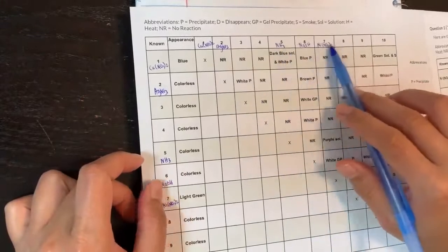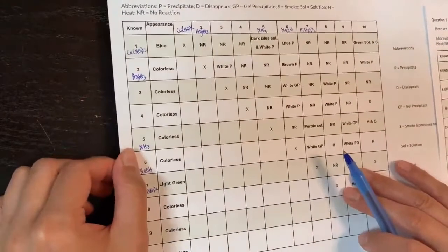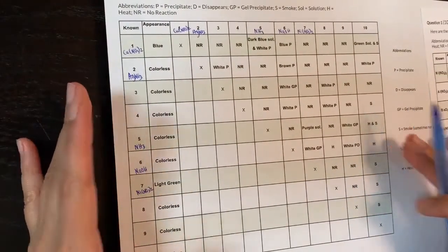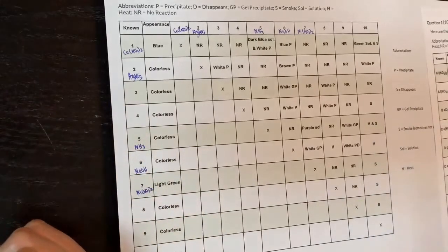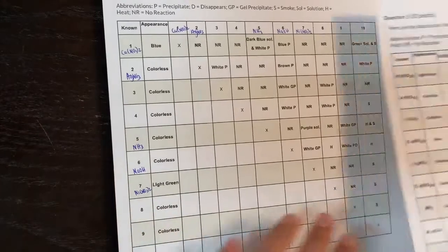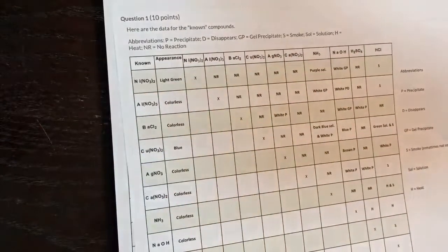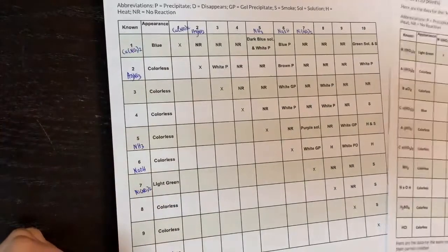We've now identified five of the ten chemicals. You can fill in the rest until you get all ten using the same method. Once you're comfortable doing this with the practice quiz, go ahead and take the real results quiz. The quiz will have all the labels removed and replaced with numbers one through ten, and your job is to figure out which number corresponds to which chemical using your notes.